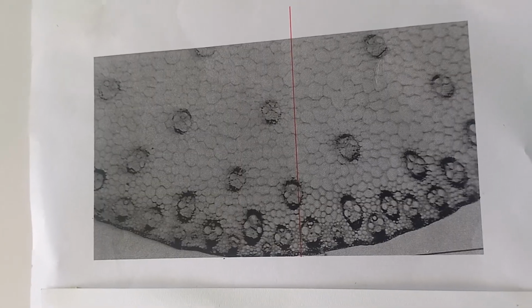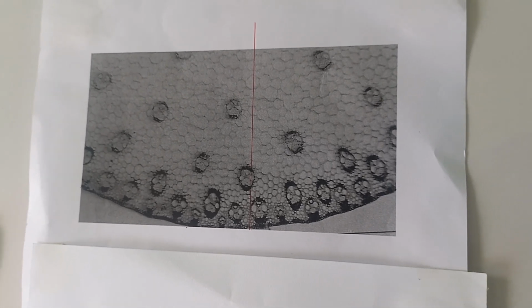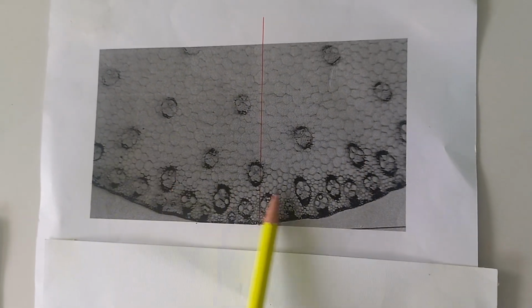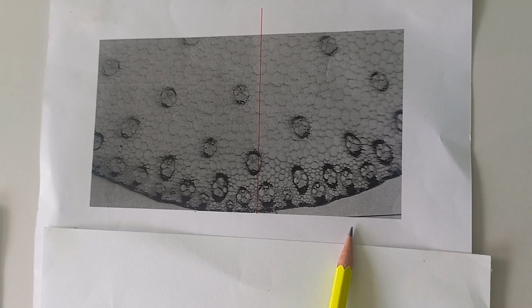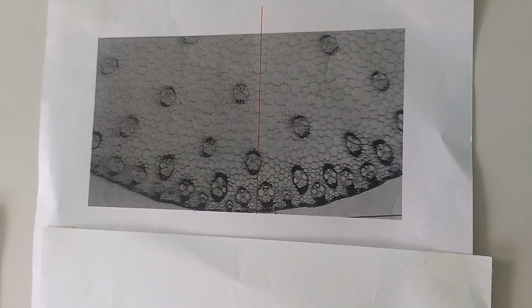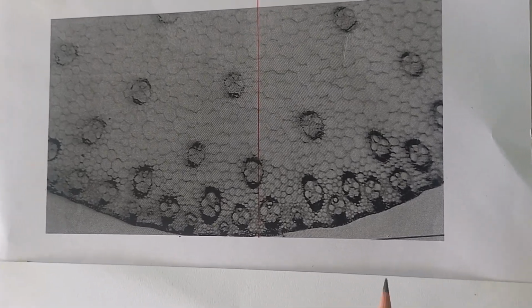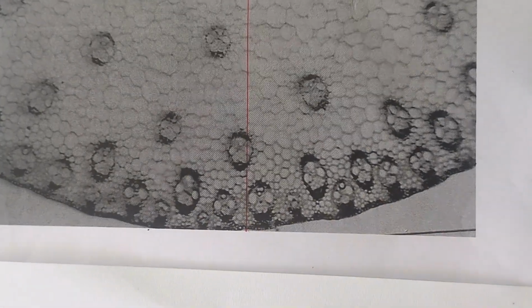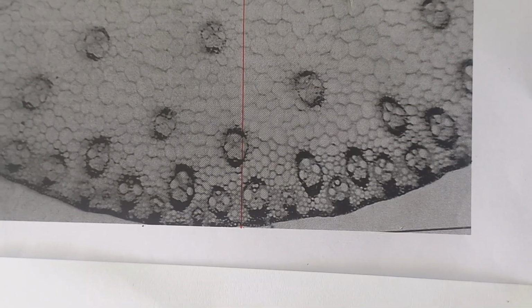So first of all, let's look at low power plan, also known as tissue map. In this one, you have these plant tissue sections. All you need to do is to map up the areas of various tissue. At low power, sometimes the individual cells cannot be seen. So I have made this one for us to use as a demonstration.